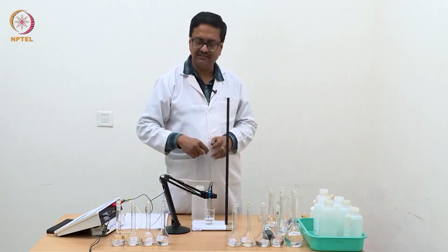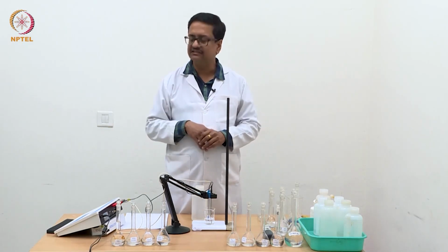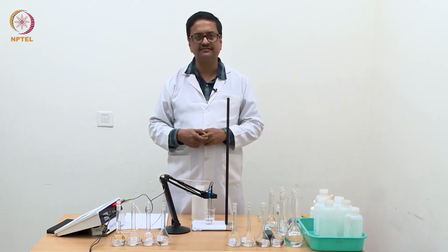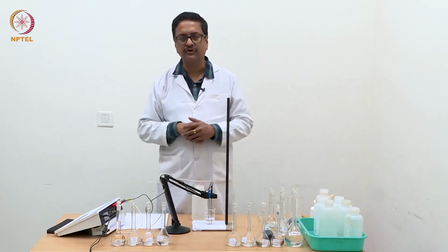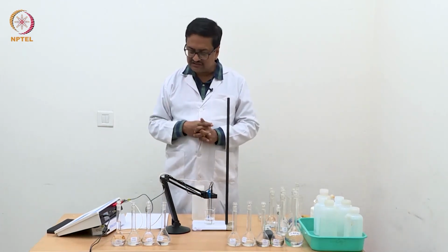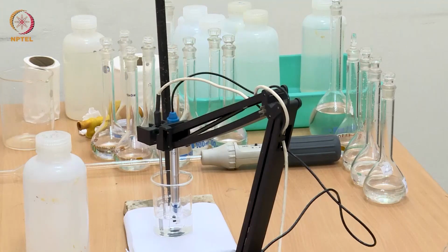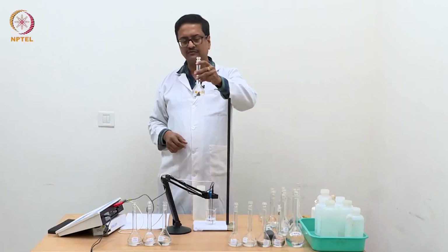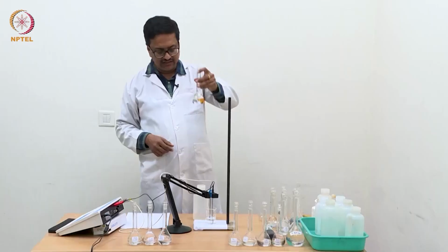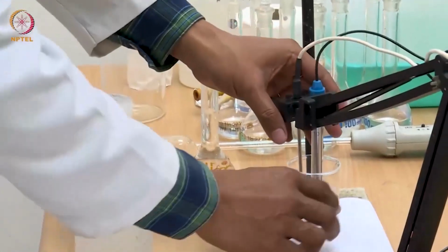So now I am going to use these dilute solutions from left to right, which is the most dilute to most concentrated, one by one as before, which we have done for HCl. We will do the same with these acetic acid solutions and take the reading of conductance for all these solutions, and then we will plot the equivalent conductance versus square root of concentration afterwards. So let us start by taking the N/256 solution. I am going to use this N/256 acetic acid solution to start with, and then slowly I will go ahead with more and more concentrated solutions.